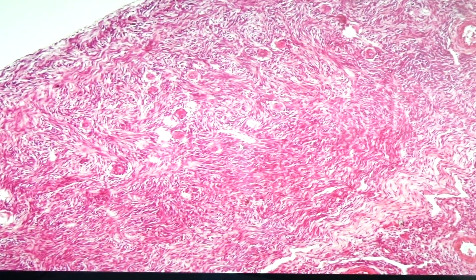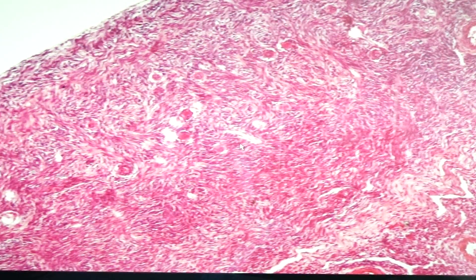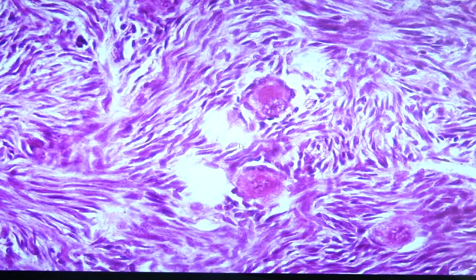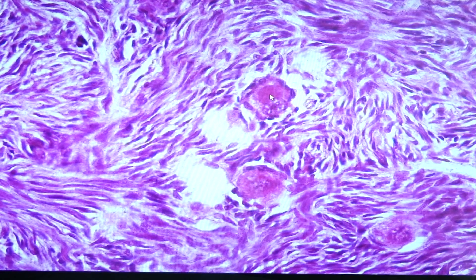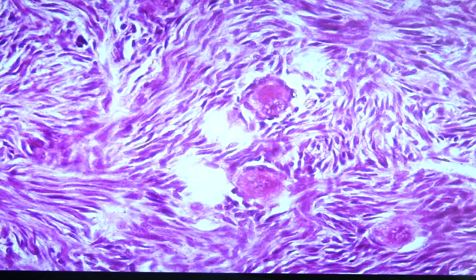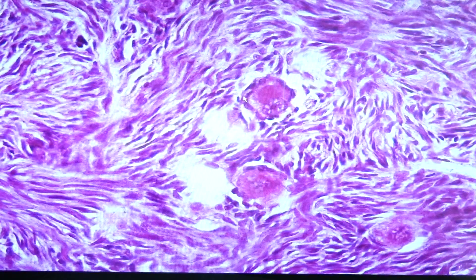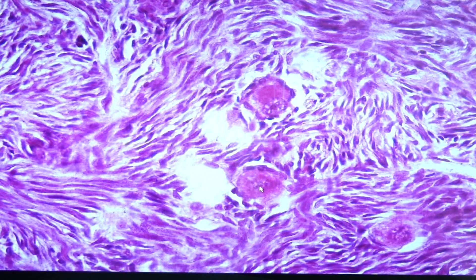The smallest or earliest type of follicle present here would be the primordial follicle. The primordial follicle would be composed of an oocyte — this would be the oocyte with the nucleus and the cytoplasm which we would call as the ooplasm. It would be surrounded by squamous follicle cells that are flattened, and the outer covering would be called the basal lamina.